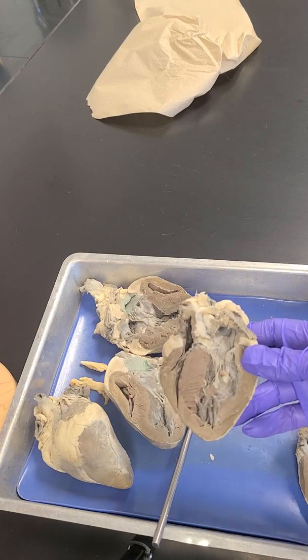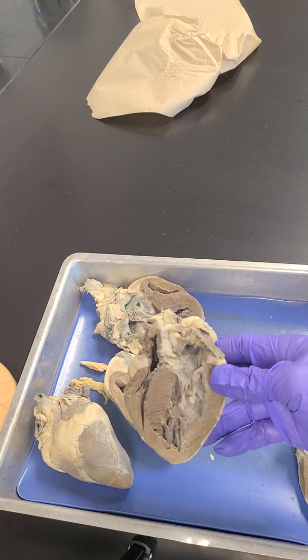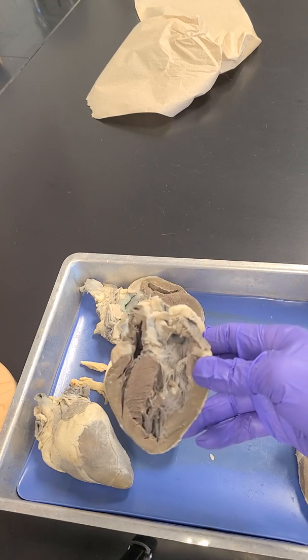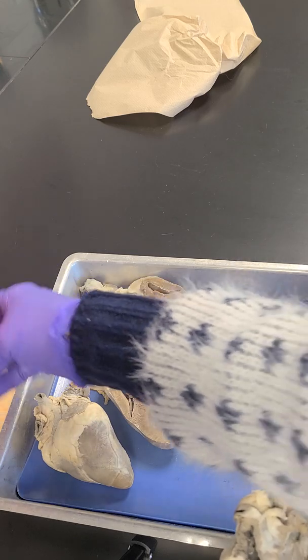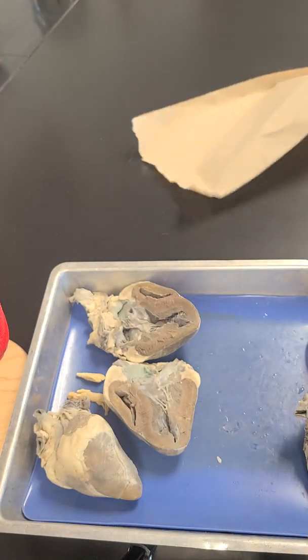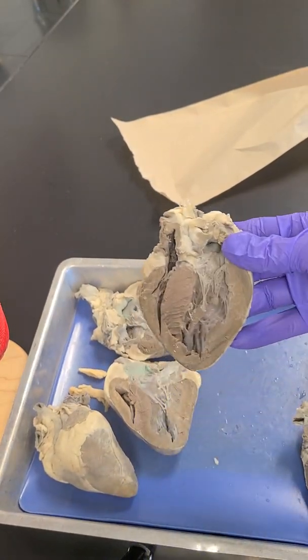Okay, this is going to be the sheep heart dissection video on identifying different parts of the sheep heart from the list that was posted, sheep heart and modeling label. You should also be able to identify these structures on the model heart, but they are not going to be on this assignment. This is just focusing on identifying on the sheep heart.